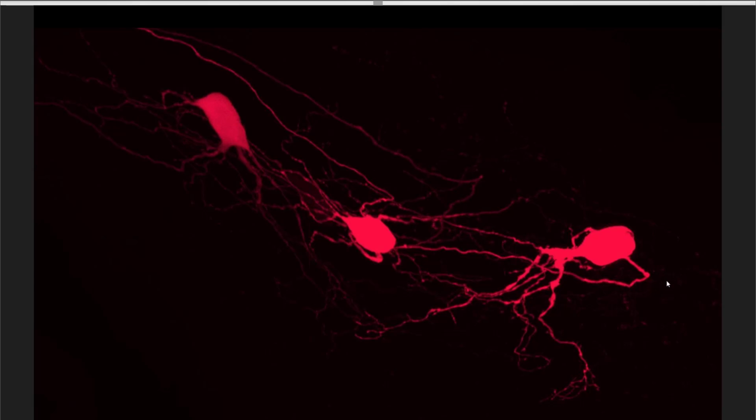To demonstrate employing this terminology in an experimental workflow, we're going to use one of the samples from Dr. John Tompkins' lab at UCLA. This data uses a wide variety of segmentation elements, making it a great demonstration for naming these elements with FAIR terminologies. Segmentation data with FAIR terminologies can be applied to a variety of microscopy image data, though. This particular SPARC research lab has used MBF Bioscience software to perform multi-resolution image segmentations to understand the structure-function relationships of the cells within the stellate ganglion.